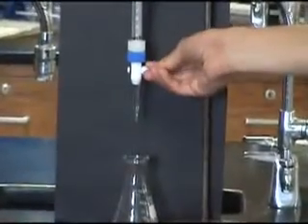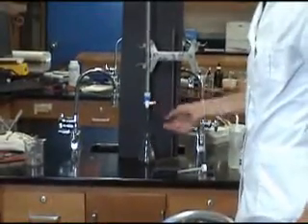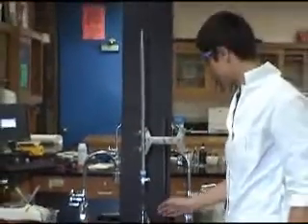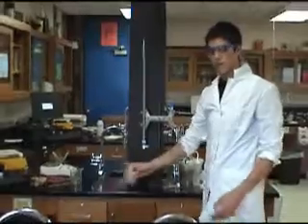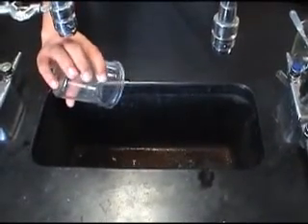Remove the funnel and slowly release the valve on the burette, allowing the excess NaOH to drain to fill the nozzle at the bottom. Do this until the bottom of the meniscus is just on the zero line. When you are recording your observations, make sure you never subtract from 50. Drain the solution containing NaOH and excess distilled water into the sink.